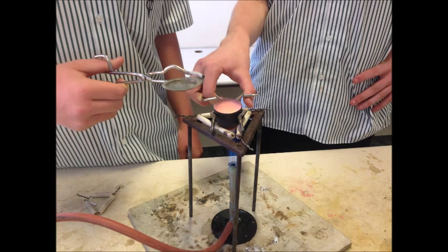The experiment was still a success, as it demonstrated that after the chemical reaction of burning magnesium and forming magnesium oxide product, there is an increase of mass.